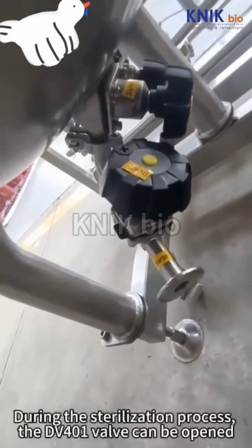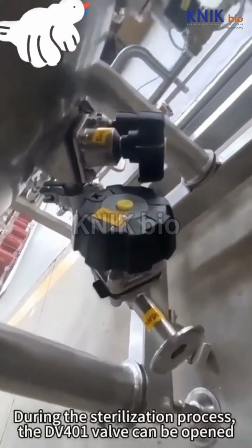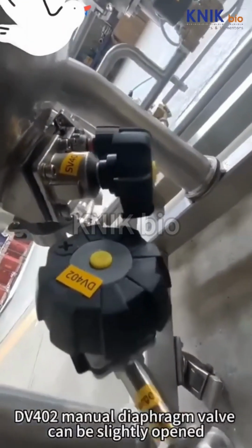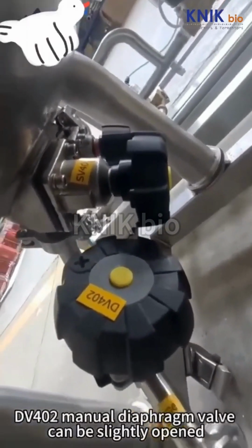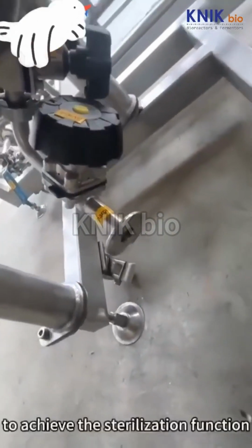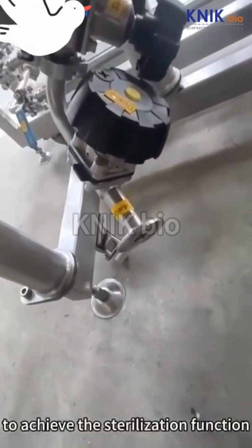During the sterilization process, the DV401 valve can be opened. DV402 manual diaphragm valve can be slightly opened to achieve the sterilization function.